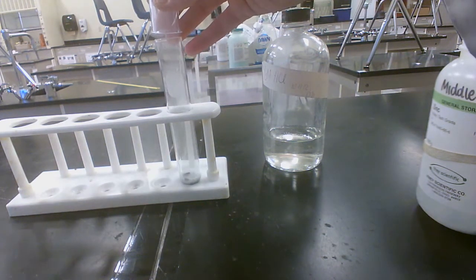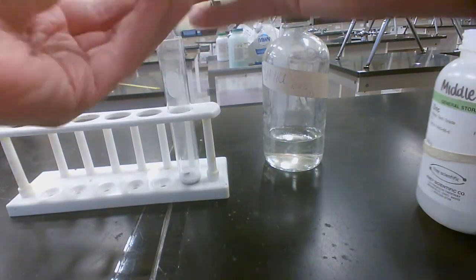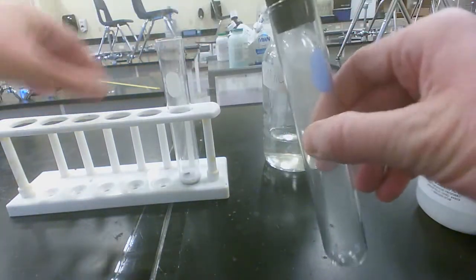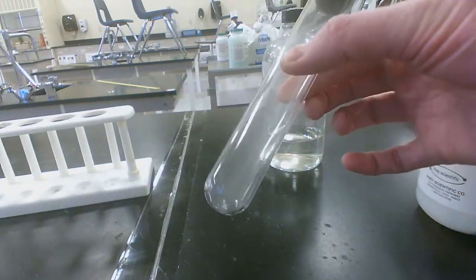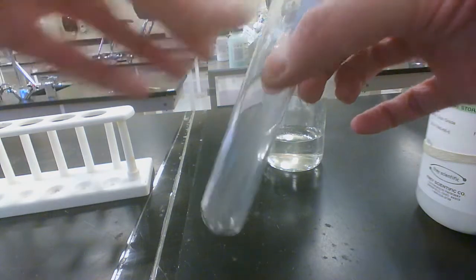Okay, I think I've captured enough, so I'm going to cap it up. Colorless. Now I'm going to set that down.